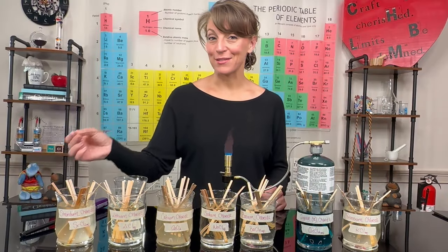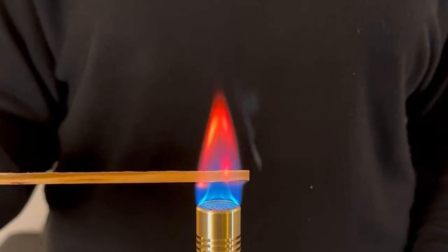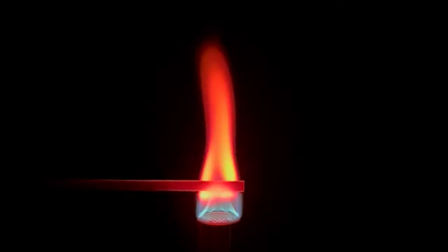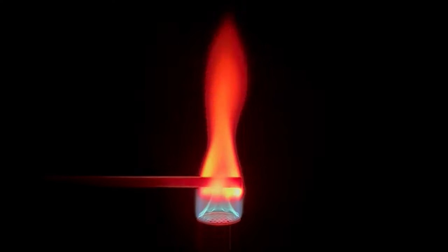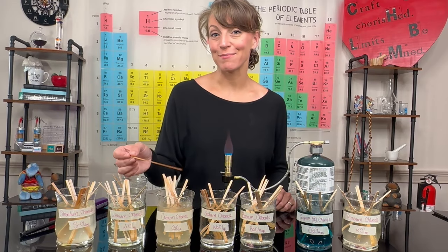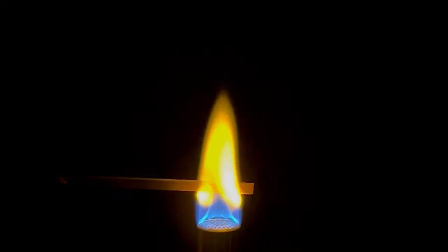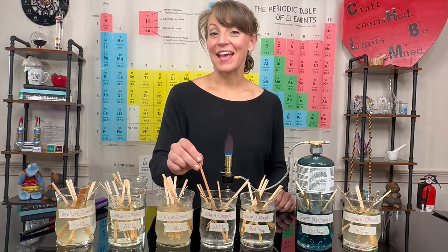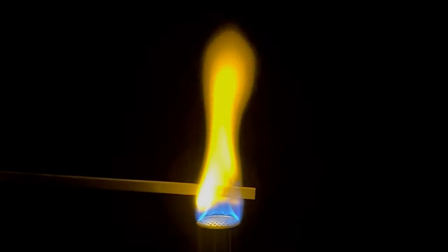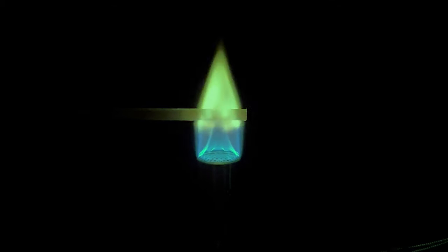First we have strontium chloride, which causes the flame to turn bright red. Next we have lithium chloride, which produces a pretty magenta pink color. After that we have calcium chloride, which causes the flame to turn orange. Next we have table salt, or sodium chloride, which produces a yellow flame.